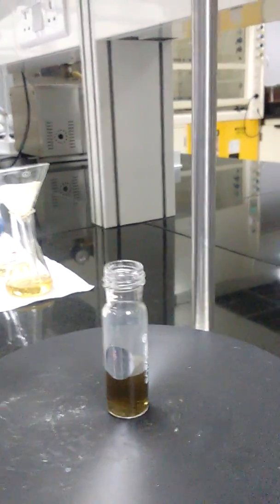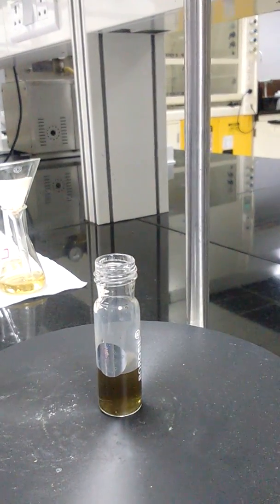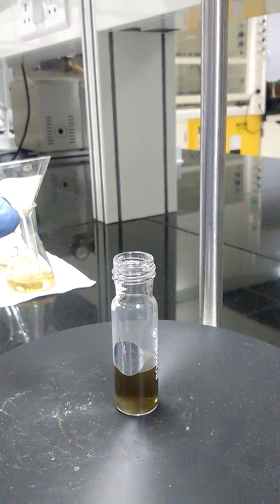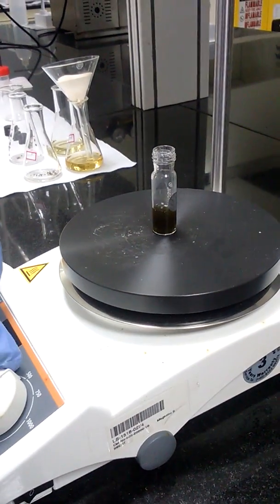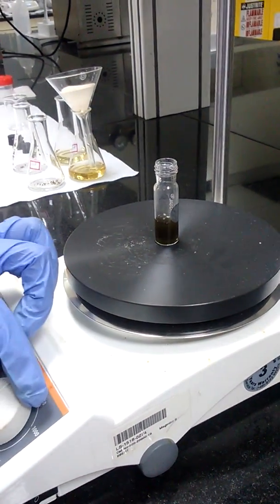Change in color observed. After 15 minutes, stop the stirring.